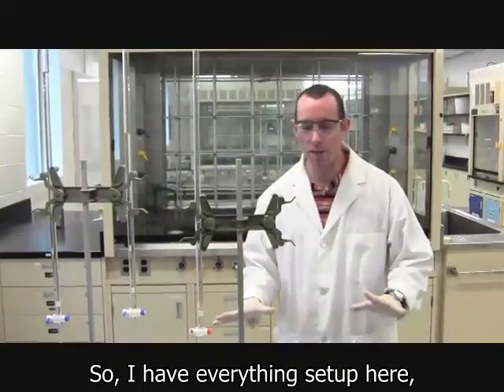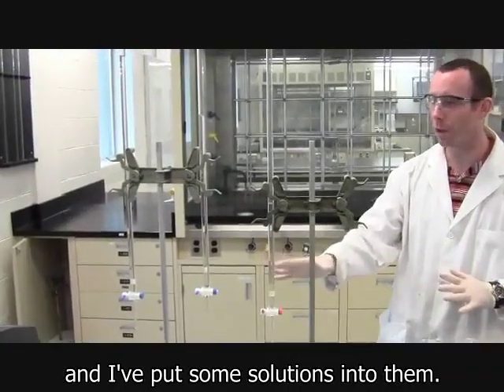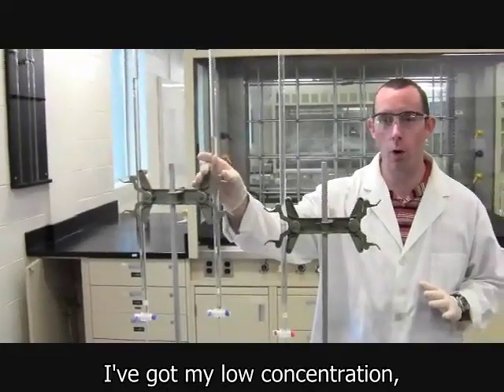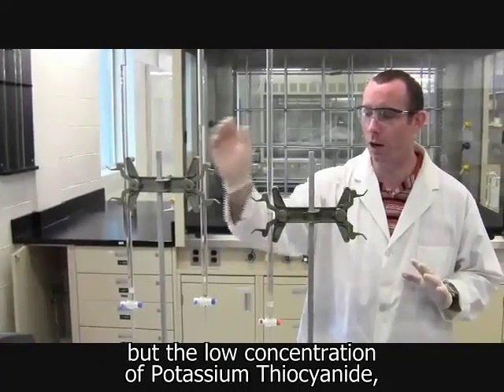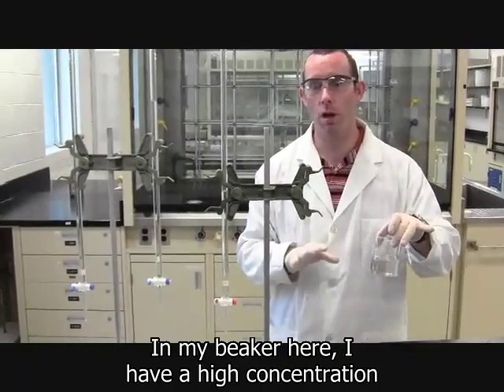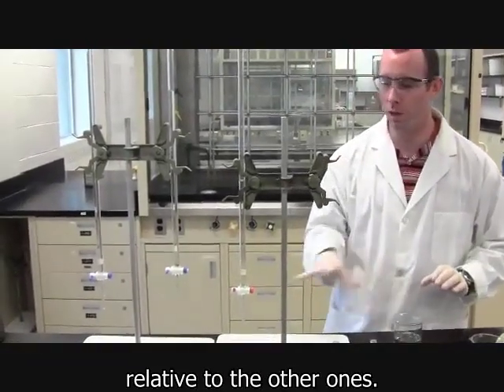So I've got everything set up here. What I've done is I've cleaned out some burettes and I put some solutions into them. Over here I have my low concentration of iron nitrate. I've got the low concentration of potassium thiocyanate, and I have some water. In my beaker here, I've got a high concentration of iron nitrate, so 0.2 mole. And I'm going to be using a lot of this relative to the other ones.